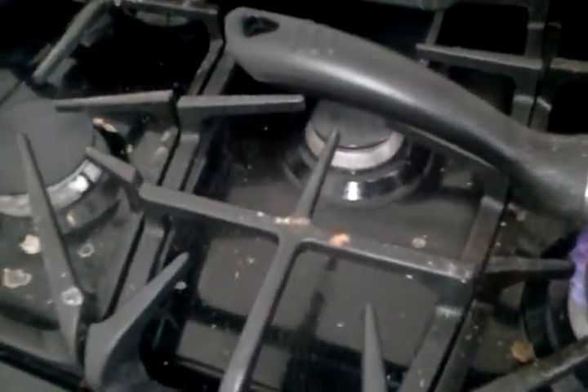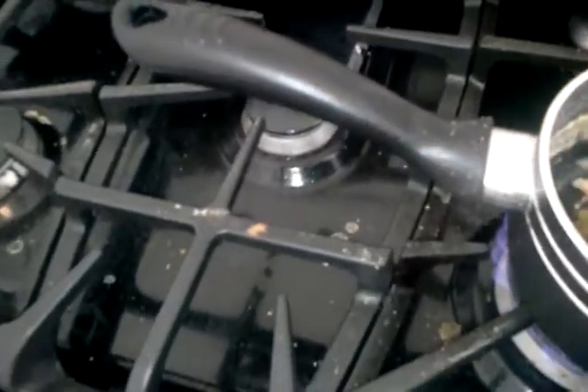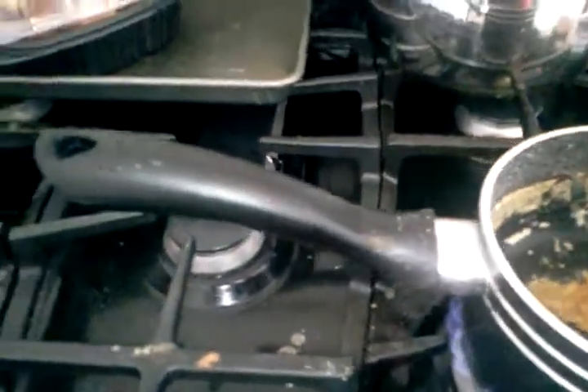This is about the time where you should start using your big ladle spoon, or a spoon that's a bit bigger, so that way you can stir it a bit more thoroughly. At this point you should get a piece of aluminium ready. Now you should turn down the heat a bit and just get it — put your spoon in here.